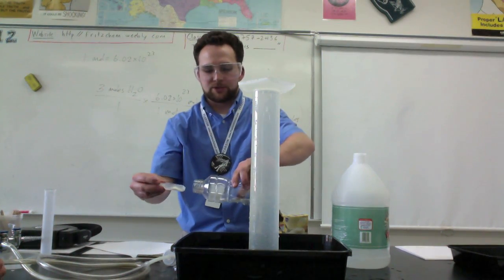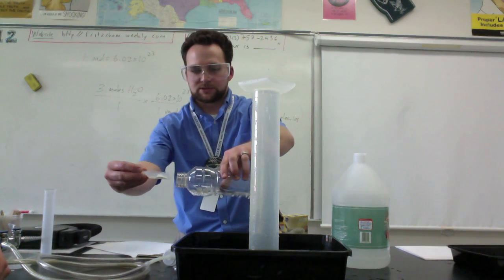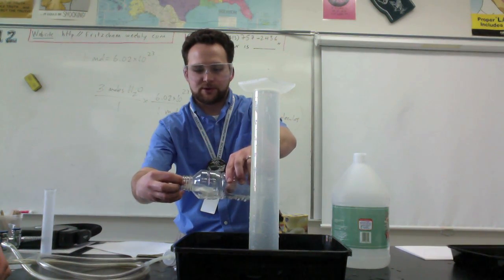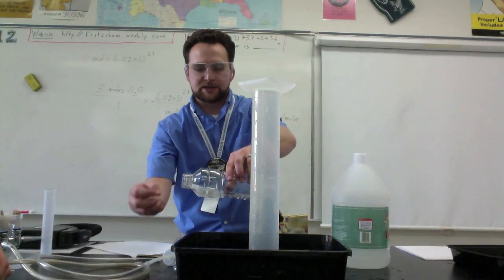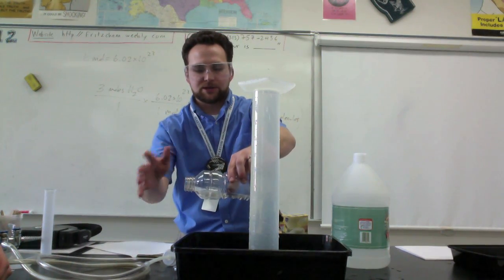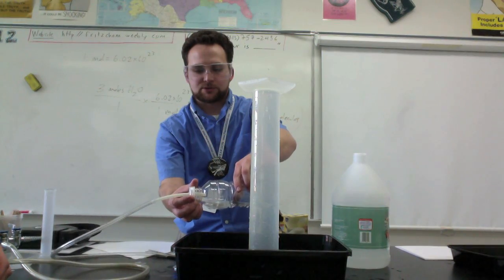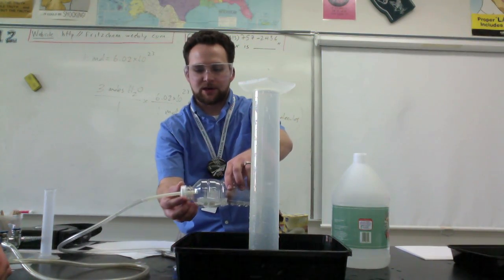So now what I'm going to do is carefully put this little guy in here. I don't want it to tip over because I don't want the baking soda to react with the vinegar, so I'm just going to set it inside there like that, making sure the vinegar doesn't get in there. Then I'm going to carefully screw the cap on there, and you might want to have somebody help you with this part.